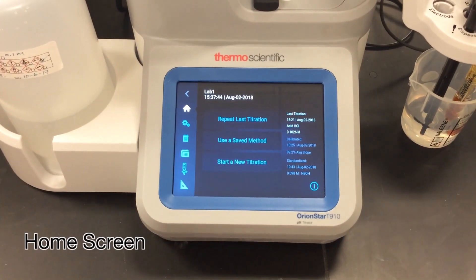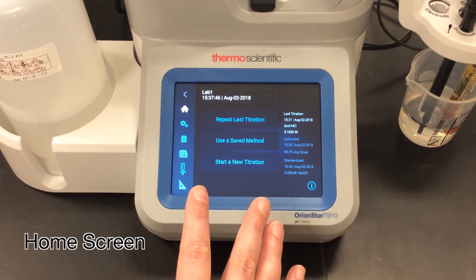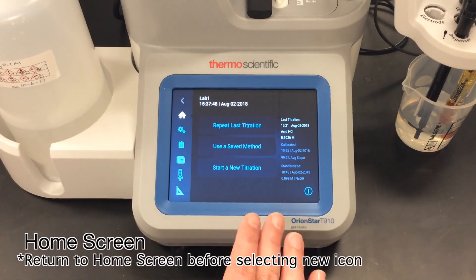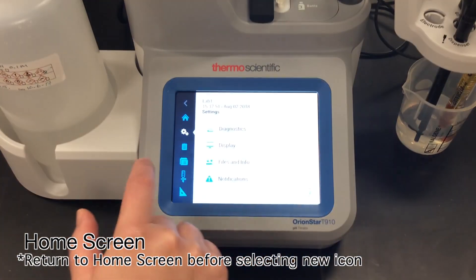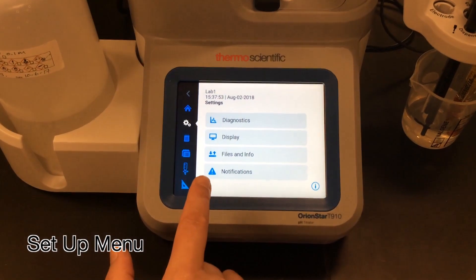I'm on the titrator home screen, and from here I have access to pretty much all the titrator functions I need. The first thing I'm going to do is go ahead and look at my setup menu.